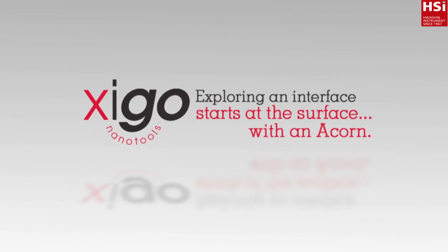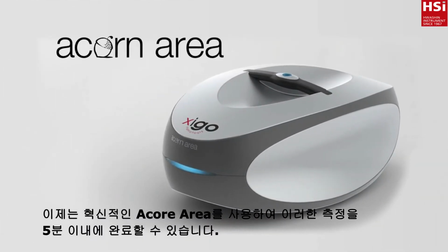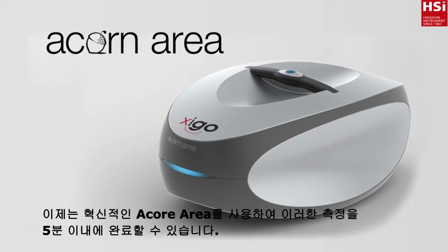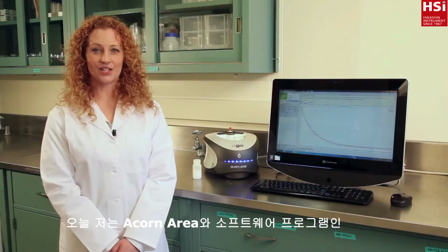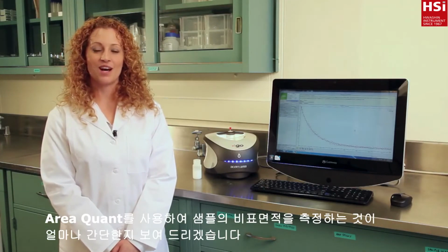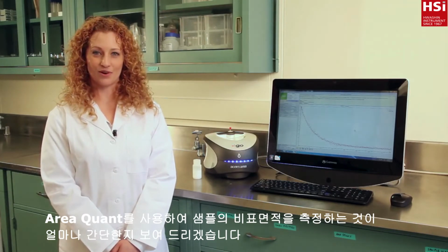Making surface area measurements used to be a time-consuming and laborious process. But now, using the revolutionary Acorn Area, these measurements can be done in as little as 5 minutes. Today, I'm going to show you just how simple it can be to make a surface area measurement of a sample using our Acorn Area and Area Quant software program.